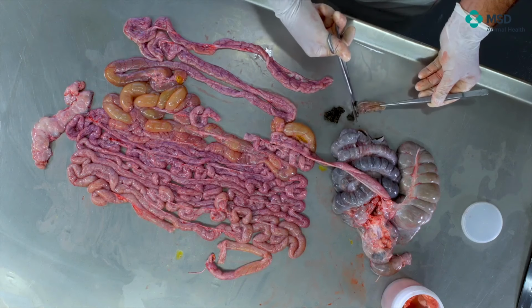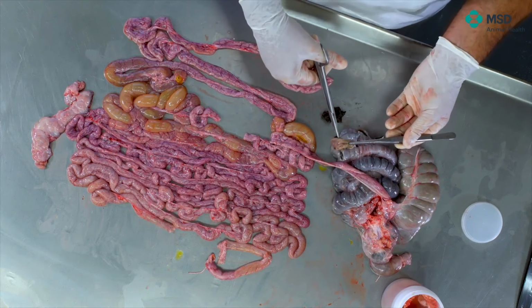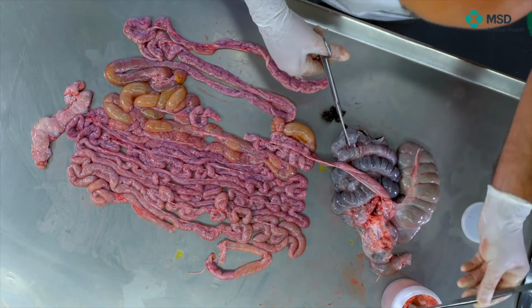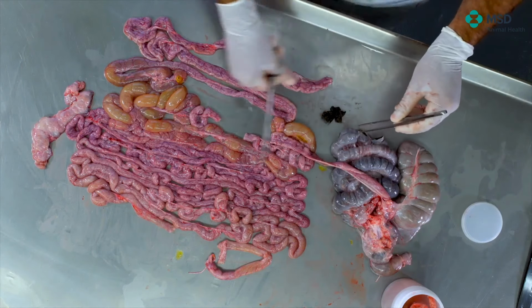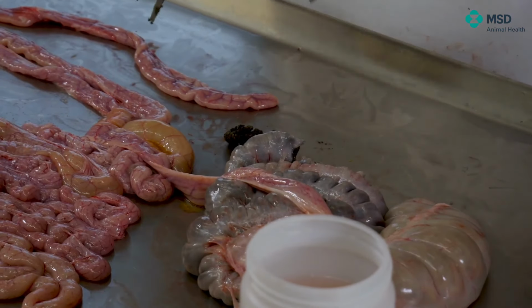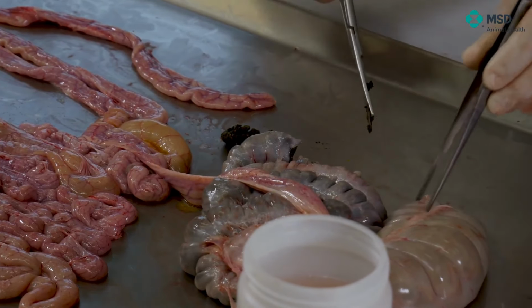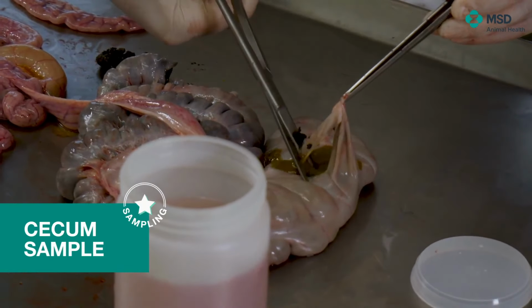However, please don't touch the mucosa with the scissors or the forceps. Try to do it in a gentle manner in order to preserve the mucosa. This is very important, okay? Because, of course, if I'm not doing so, by just taking out the feces, touching the mucosa, I'm destroying the mucosa. In the cecum, we can take one part of cecum.